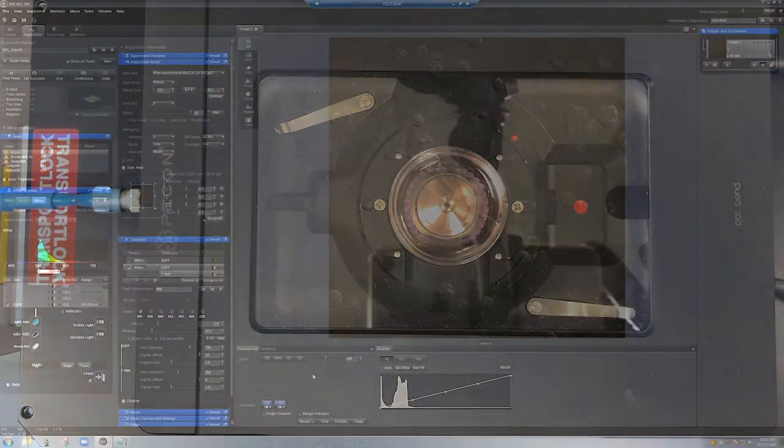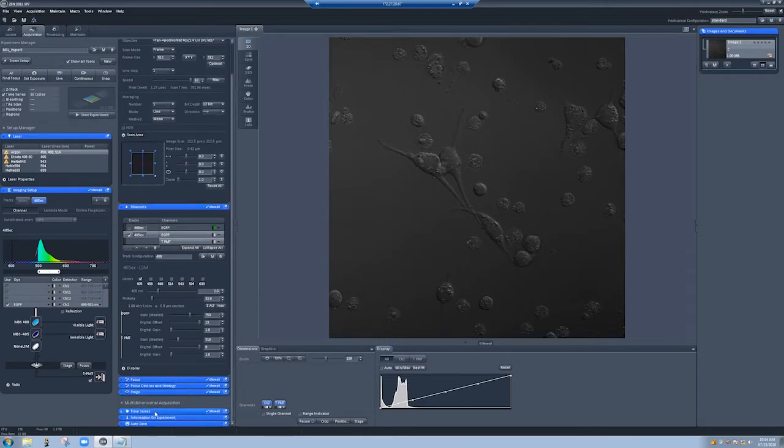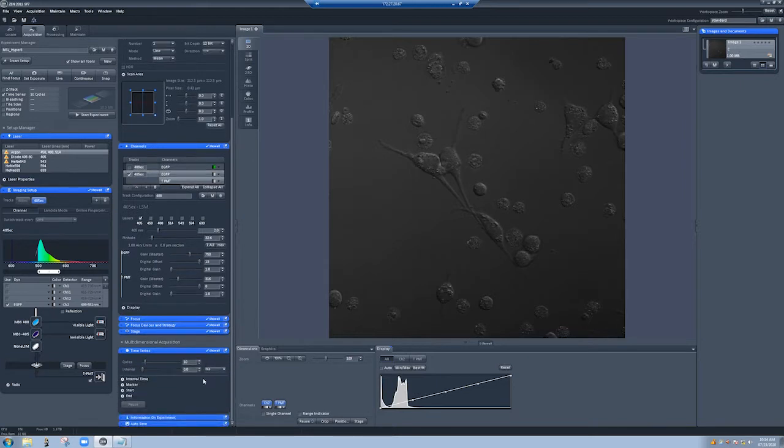All right, so I've placed the sample on. I've focused by eye on something, and you can see here a DIC image of the particular field I'm in. So how do we set up a time lapse? If you have live cells, it's typically because you want to look at how they evolve over time. And so how do we do that? The way we do that is we click on time series. Now you'll see we will have a time series tab here.